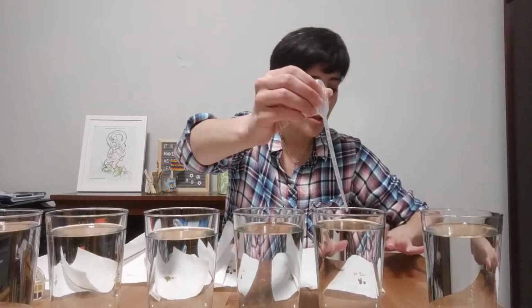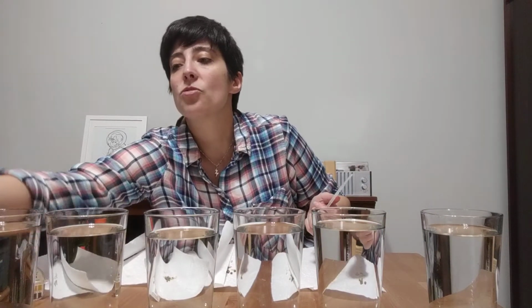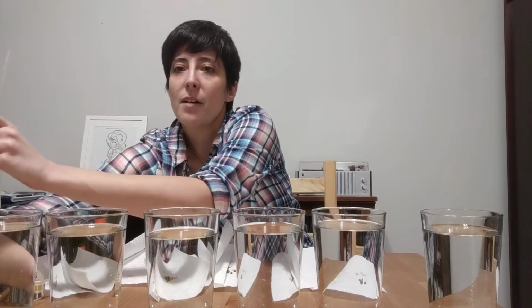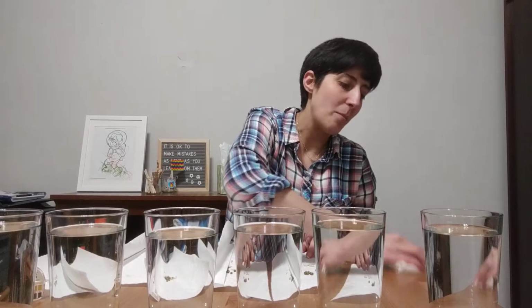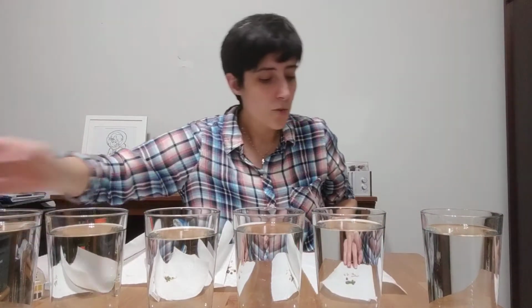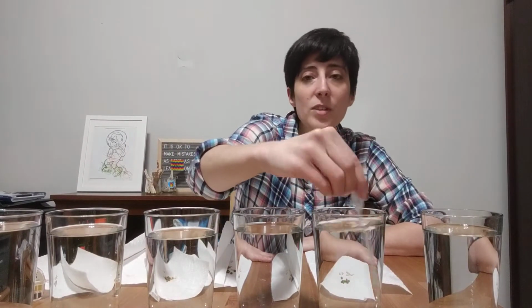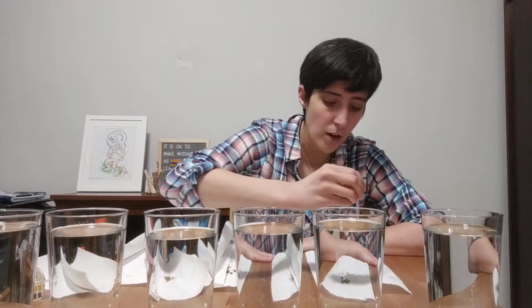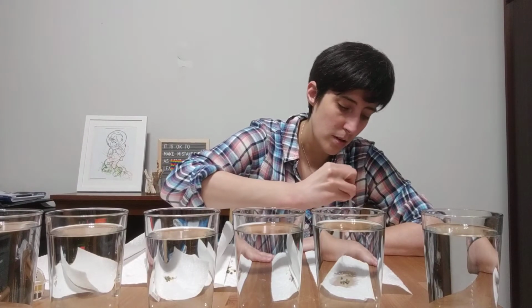I'm going to kind of scooch these over, and I'm going to grab this dry paper towel here that I have still. Always important to have dry paper towels when you're doing water labs, apparently, to just wipe off some of this surface so I can kind of scoot over a little bit. That'll give me room to kind of slide over as we go. All right, so this one only had 4 mLs of vinegar, so it's probably going to be about the same as our other one, right? Didn't see too much change in pH.